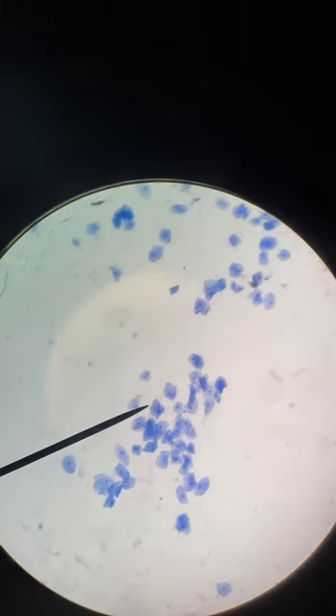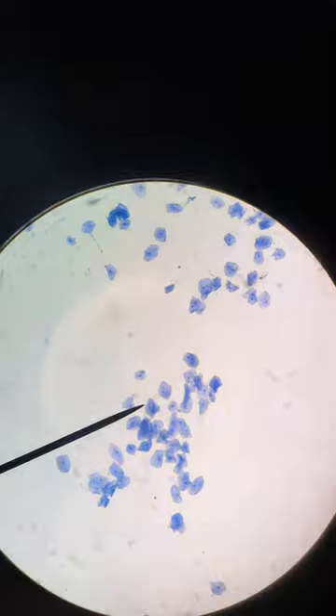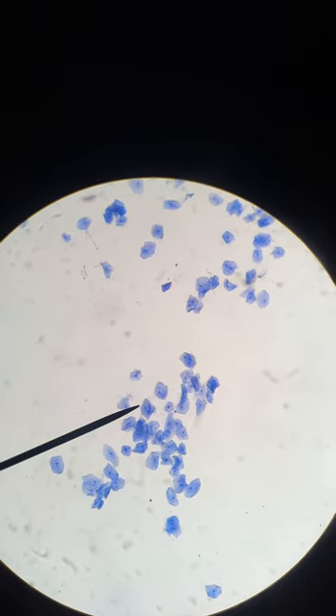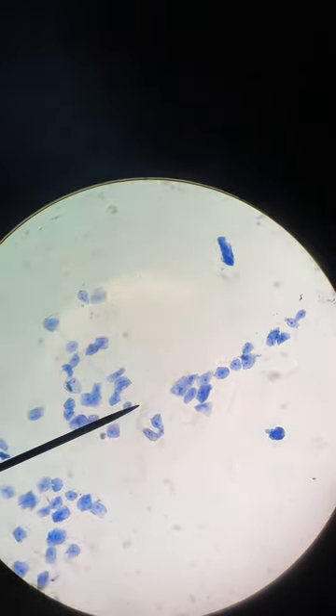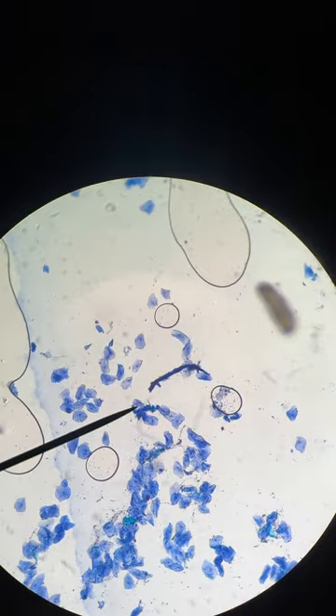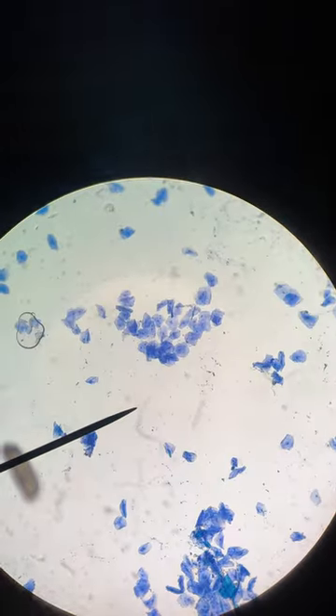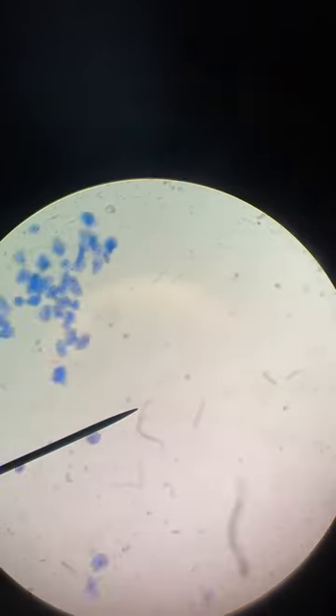Rotate to yellow objective. Re-center and re-focus. On yellow you can definitely see the nucleus, the cell membrane, and the cytoplasm — those three things. The nucleus is that dot inside. Just great cells all over the place. Go to a cluster and sketch it for yellow.